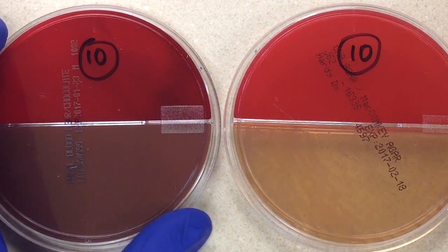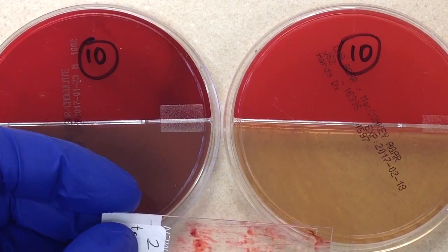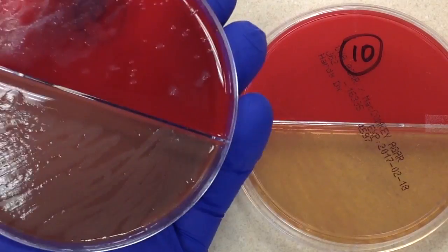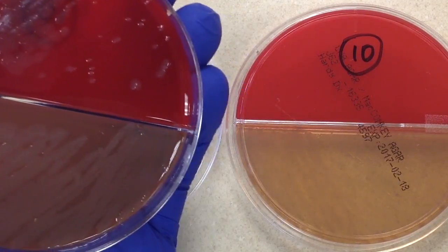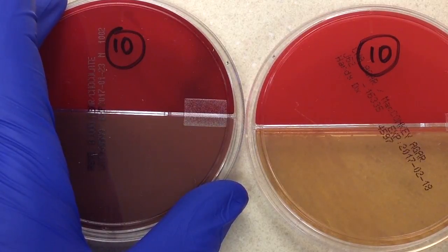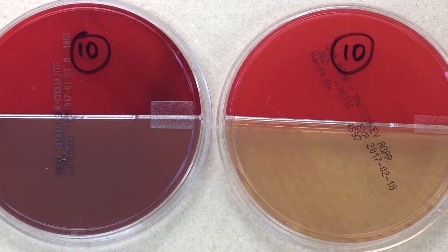At this point I need to send a preliminary report to the doctor. They've already received the direct smear result, which showed plenty of PMNs, few epithelial cells — making this a good specimen — and gram-negative rods on the slide. What I see on the plates confirms the gram stain. I'll comment that there is no normal oral flora. Based on what I see and smell — Pseudomonas has a fruity smell — and it being a lactose non-fermenter, I'm going to report many probable Pseudomonas aeruginosa, with identification and susceptibility testing to follow.